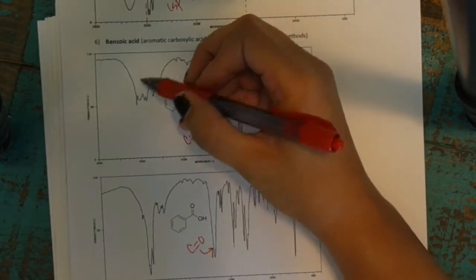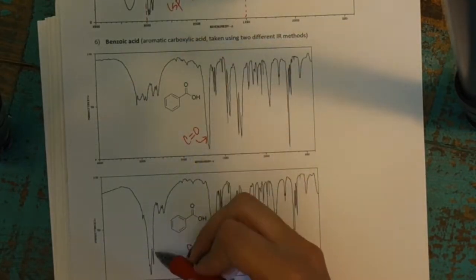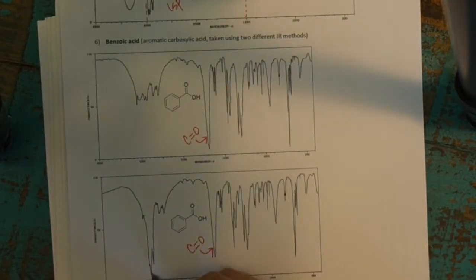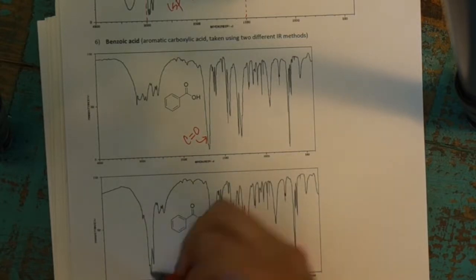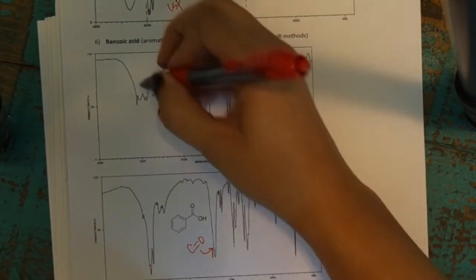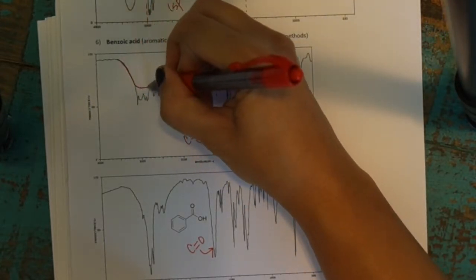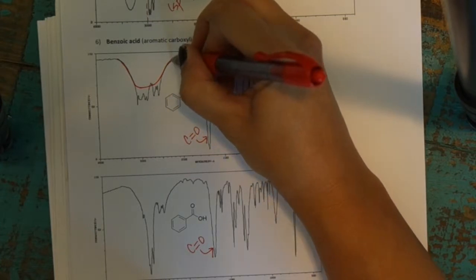And then over here, you see a bunch of stuff. In this one, down below, you can more obviously see the CH bonding, CH is poking out, but over here, they're not poking out as much. What you notice is it has this weird, broad, blobby shape instead of the normal shape that CHs normally have.